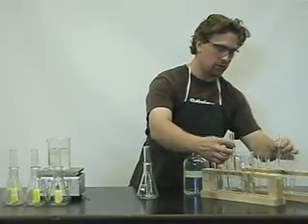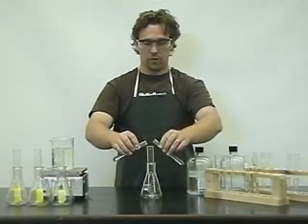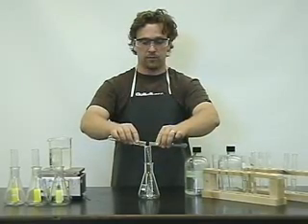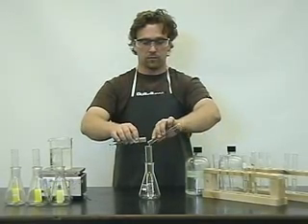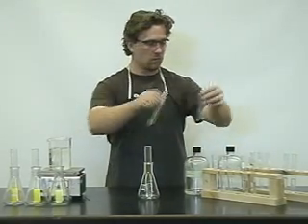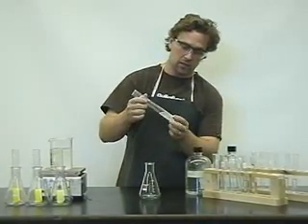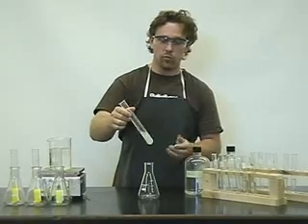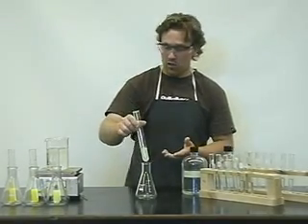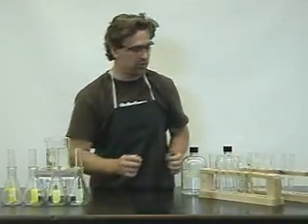We'll move on to the fourth set of test tubes. Their concentrations are 4 mL of each solution diluted to 10 mL of water. We mix them, give it a moment, and we notice a precipitate has also formed. So far, the first four mixed solutions have all formed precipitates.